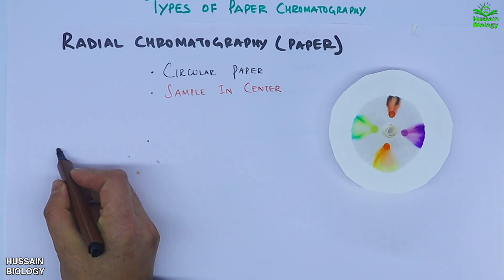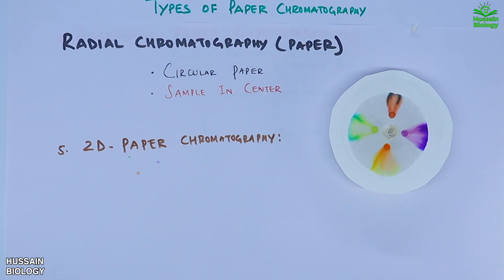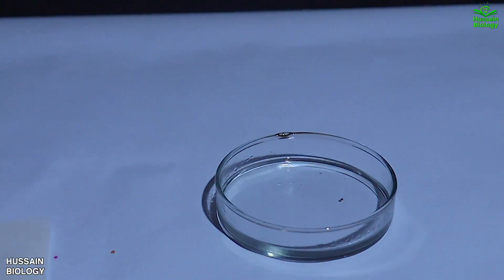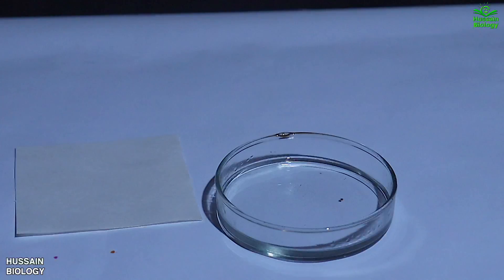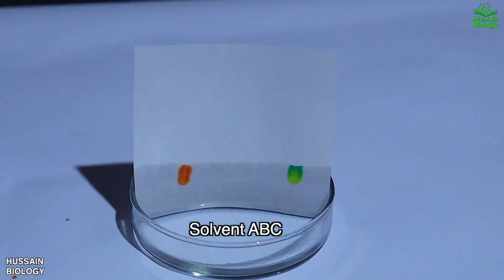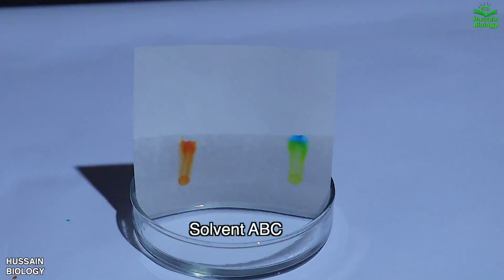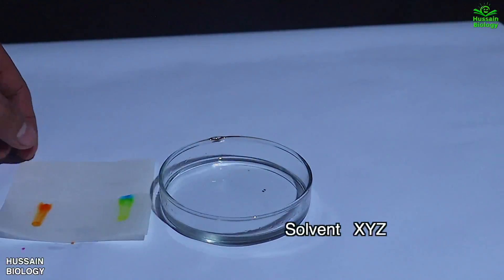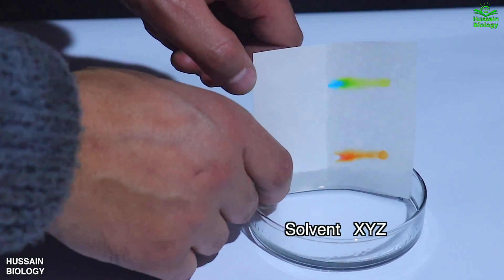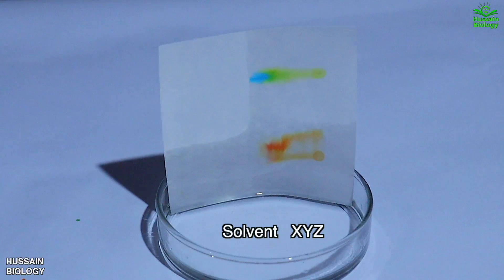The last type is two-dimensional paper chromatography, which works on capillary action but uses two types of solvents. We take the solvent in a petri dish, put ink samples on the filter paper, and place it in the petri dish so the solvent rises and separates the ink components. After getting the chromatograph, we wait a couple of hours, then rotate the same chromatogram 90 degrees and place it in a new type of solvent, running the procedure again to get a different kind of chromatogram.